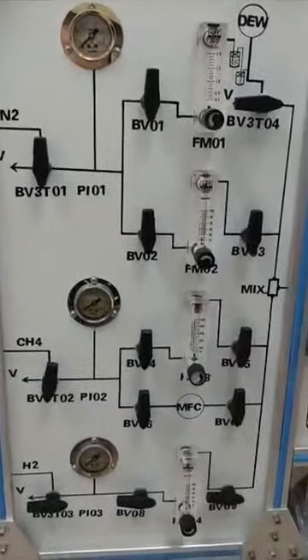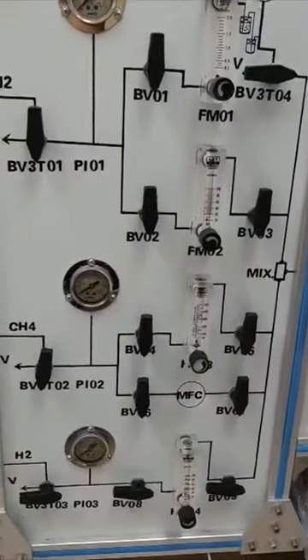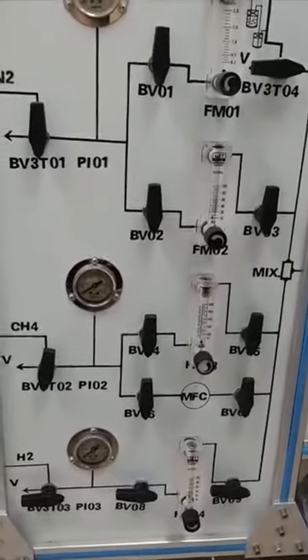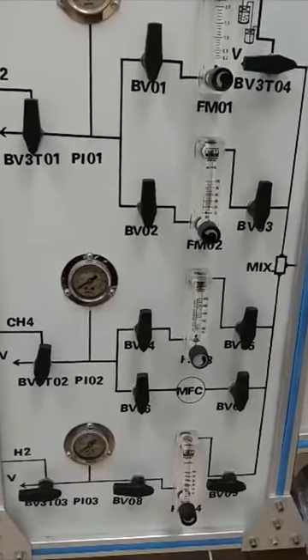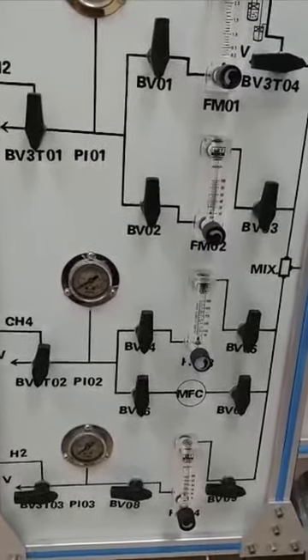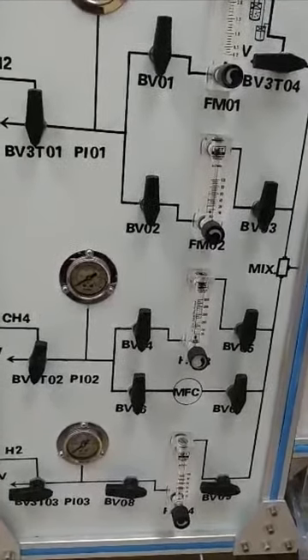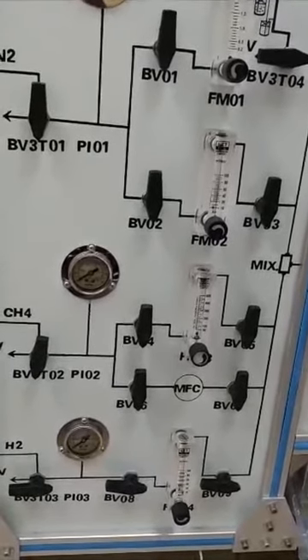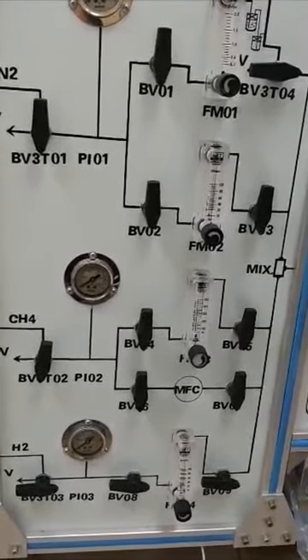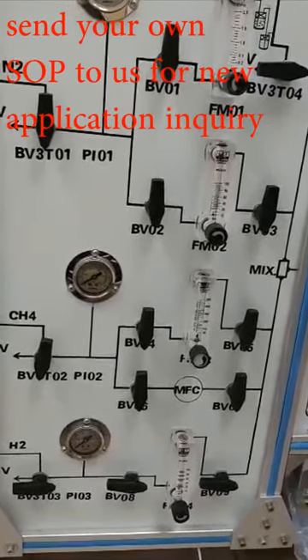So this system allows you to combine different applications. You can supply your reactant gas pure, or make your reactant gas a mixture, diluted by nitrogen, or mixed with hydrogen or other gas. This is all dependent on your experimental design. We have sent our standard operation procedure for methane reforming under optical condition to your student.